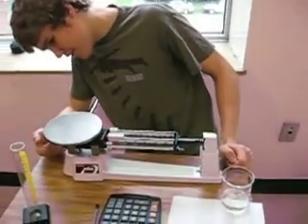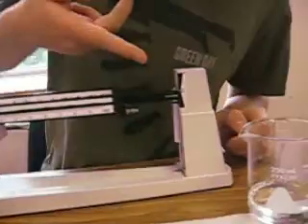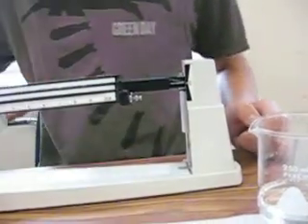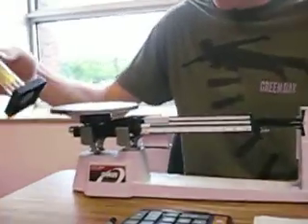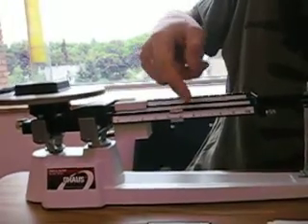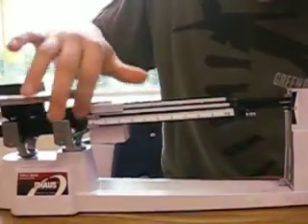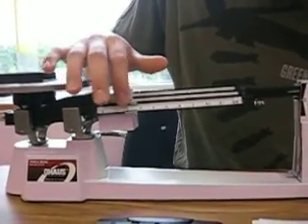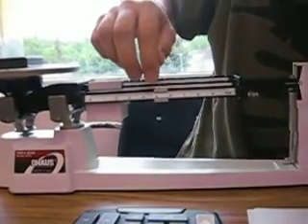Now, to level your scale, there was a knob on the end. To level out to this thing, level zero — I already did that beforehand. So, if we put this in to weigh and it doesn't go down, it means it weighs more than 10 grams. So you put this up to 10 grams and you get to the right weight.